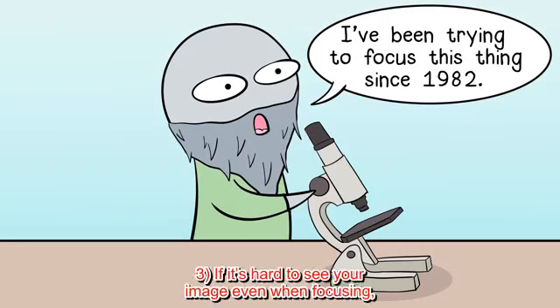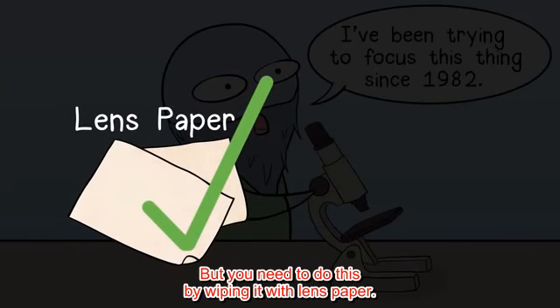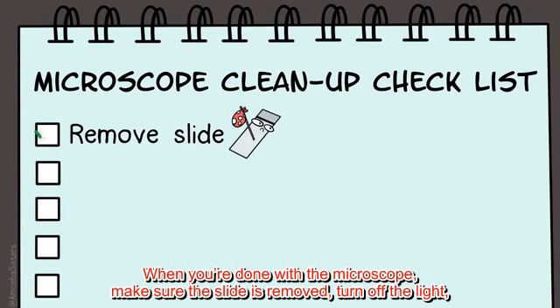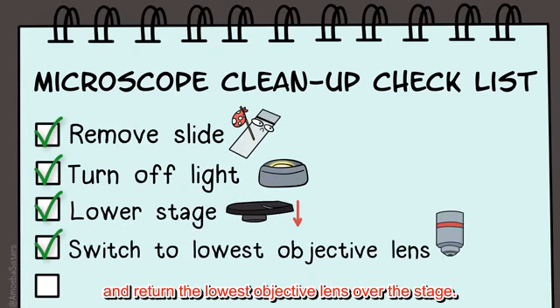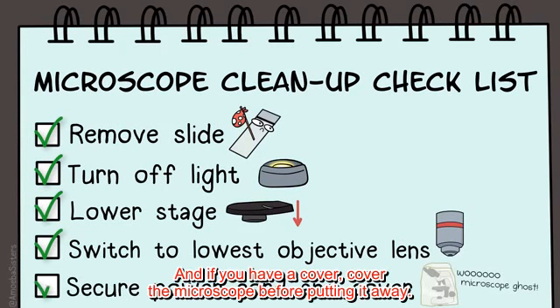And number 3, if it's hard to see your image even when focusing, you may need to clean the lens. But you need to do this by wiping it with lens paper, not regular tissue. When you're done with the microscope, make sure the slide is removed, turn off the light, lower the stage to its lowest position, and return the lowest objective lens over the stage. Unplug it, wrap up the power cord, and if you have a cover, cover the microscope before putting it away.